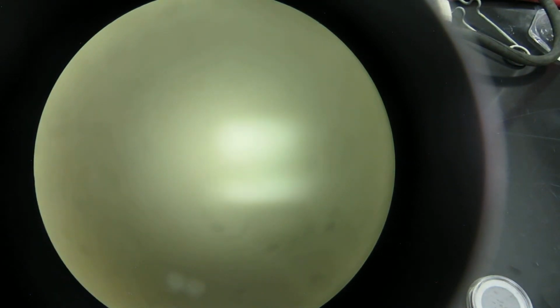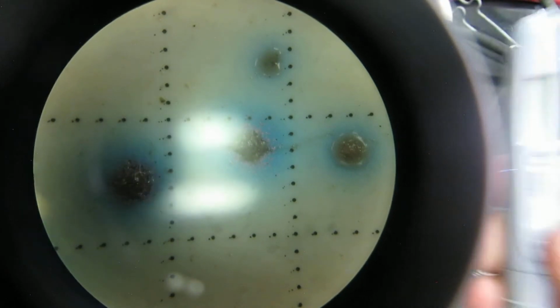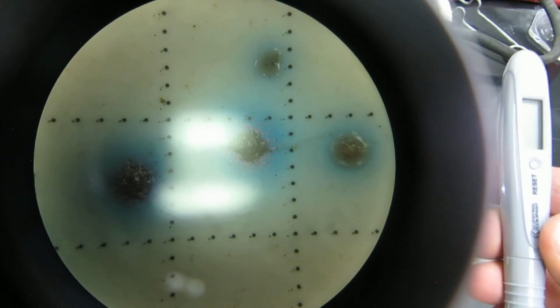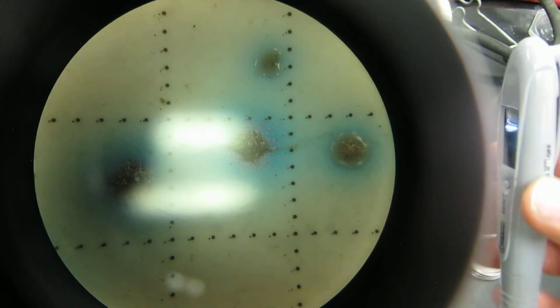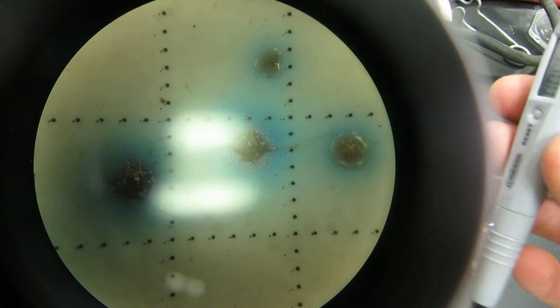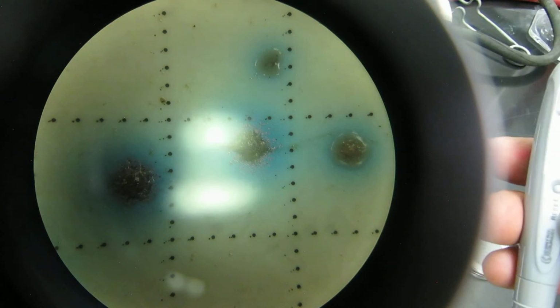Another way to count these bacteria, there's a couple different things you can do. I'll sometimes get a little counting pen, and the counting pen will look something like this. So I'll have this plate here, and then I'll have this pen, and this pen has an on-off switch. You turn it on and then adjust it so that you can count. And I already actually counted one there.